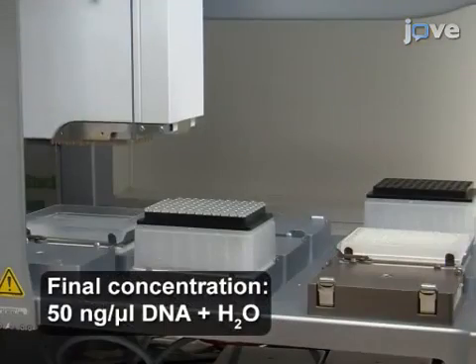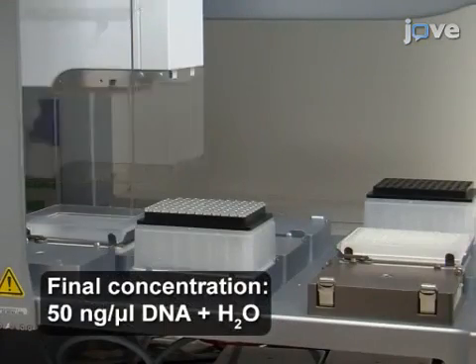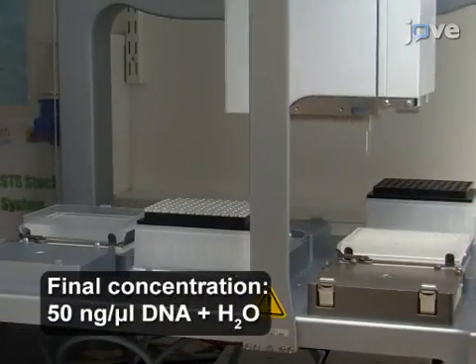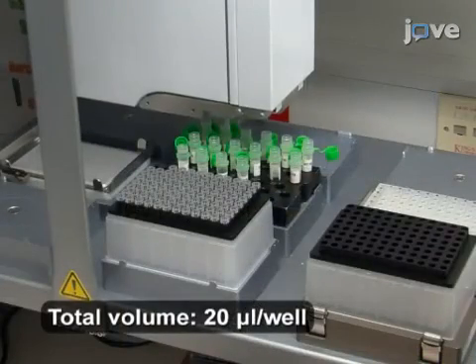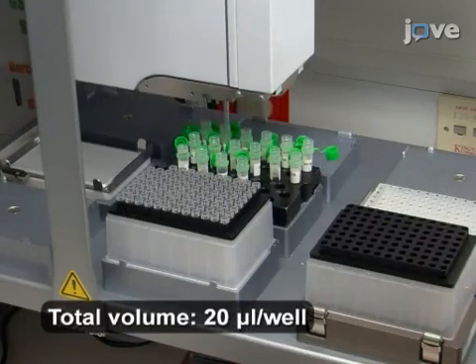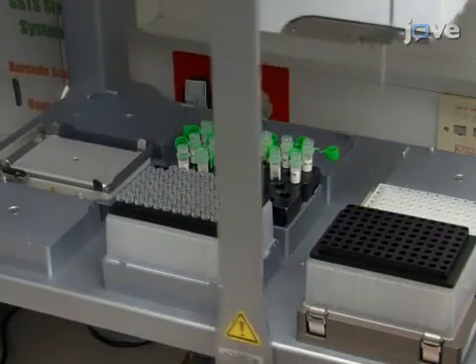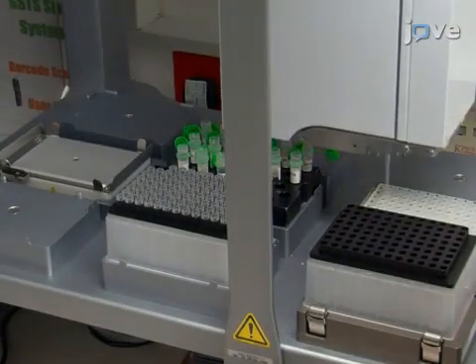While the samples are warming, use a liquid handling robot to dispense enough nuclease-free water into each well of a new 96-well plate. Then, when the DNA is ready, transfer one microgram of sample per well to the 96-well plate of water.